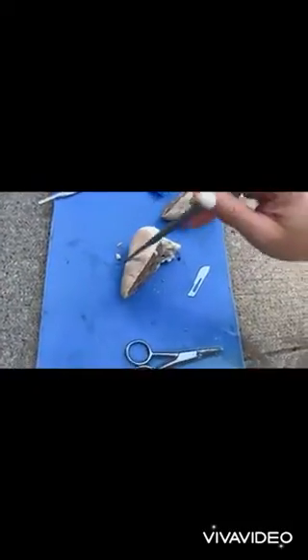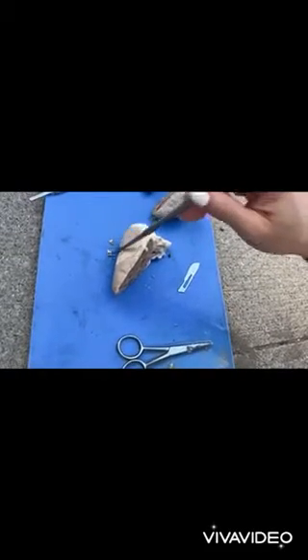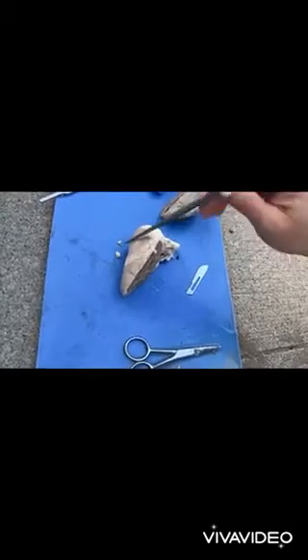Coronary arteries are the arterial blood vessels of the coronary circulation, which supply oxygenated blood to the heart muscle.